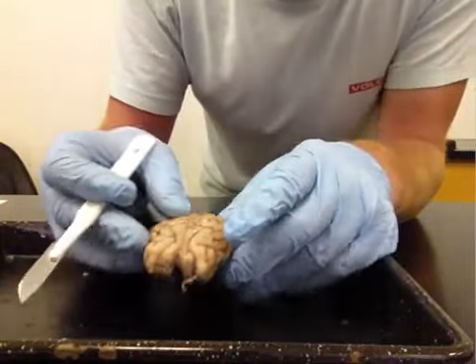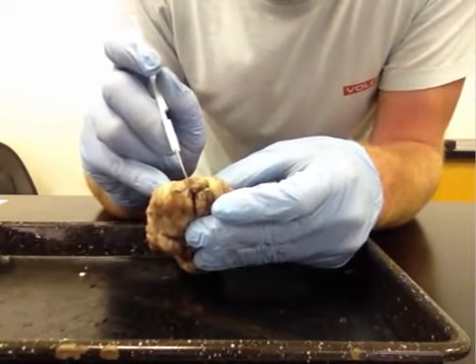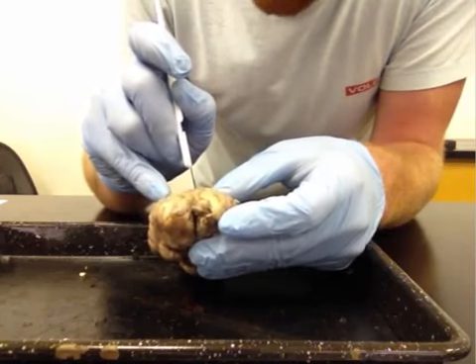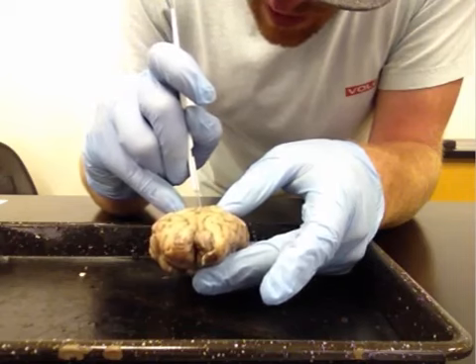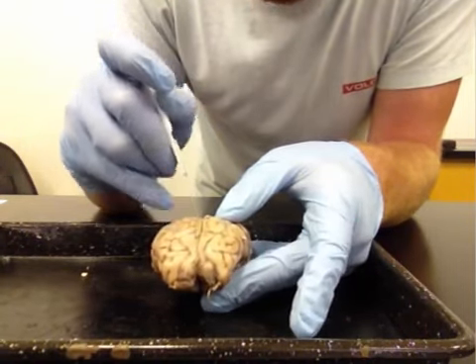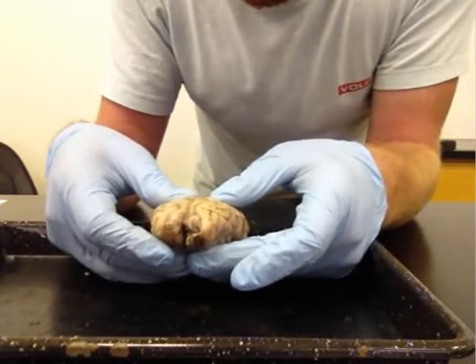that are holding the 2 sides together. So first what we're going to want to do is just very gently use the scalpel to cut away some of those meninges, just very gently applying pressure all the way to the caudal extent towards the cerebellum again. And that'll allow us just to look into the brain a little bit, get some of those meninges out of the way.